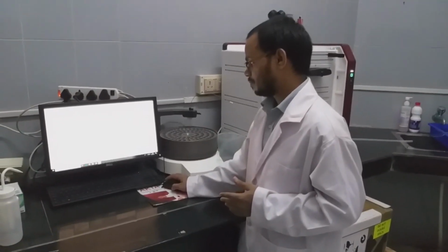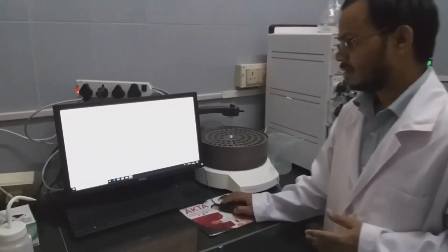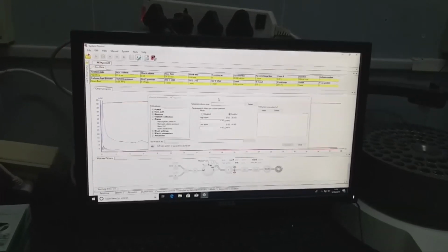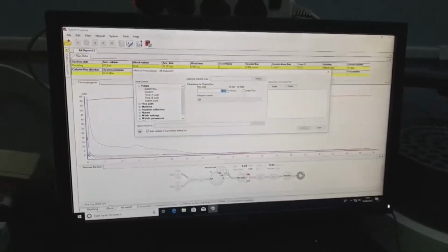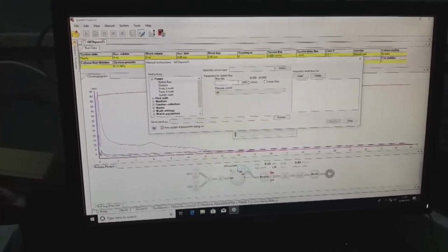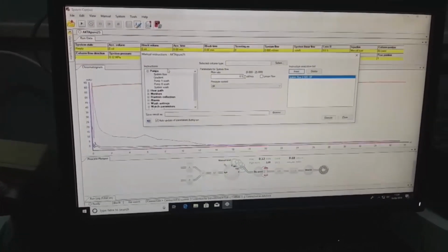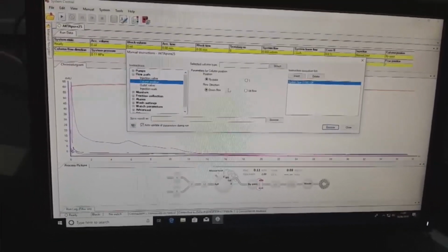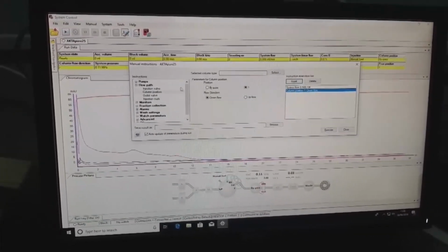Here we will end the program, and we will start a new program. We keep the system flow at 0.5 ml per minute. Insert flow path, column position at 1 and downward flow.